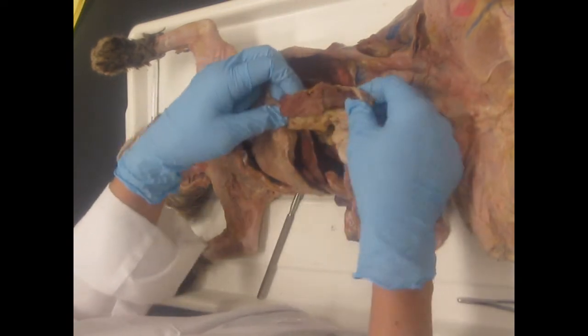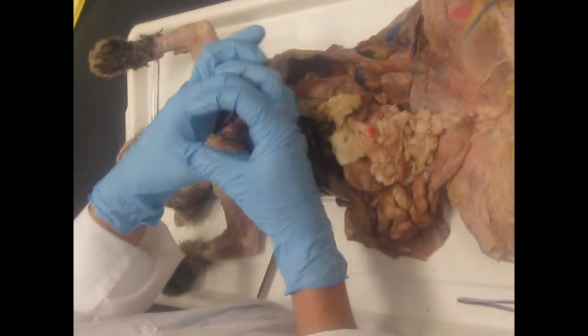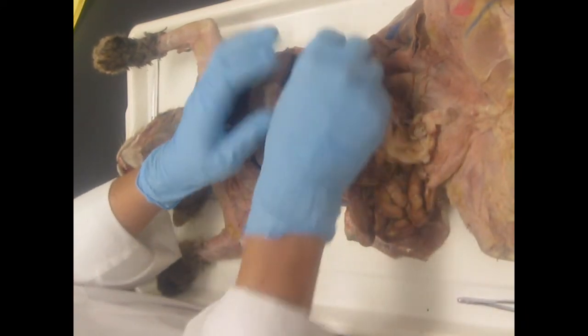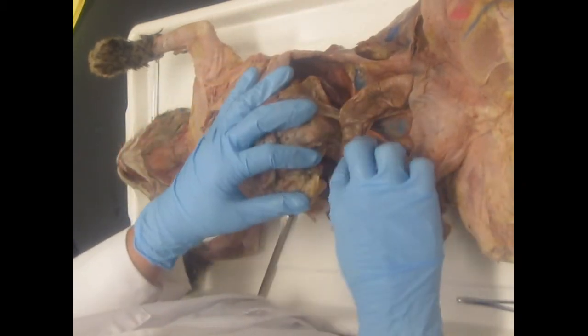And it's this elongated brown organ, like this. It's a little bit longer than it is in humans. Humans were a little more oval. Cat spleen is long, but in the same position and serves the same function. Spleen. Small intestines, we showed you that. Large intestine, along the back of the body wall.